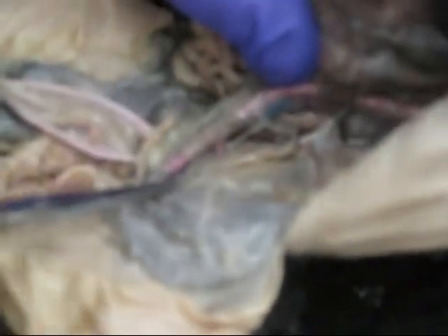All right. Yeah, these are the same thing, but basically they should be blue. And the veins are underneath on the posterior end, the bottom part of it. There is the posterior vena cava right there. It should run the length. And the renal vein should come straight out of the kidney. It can be seen right there, right next to the renal artery.